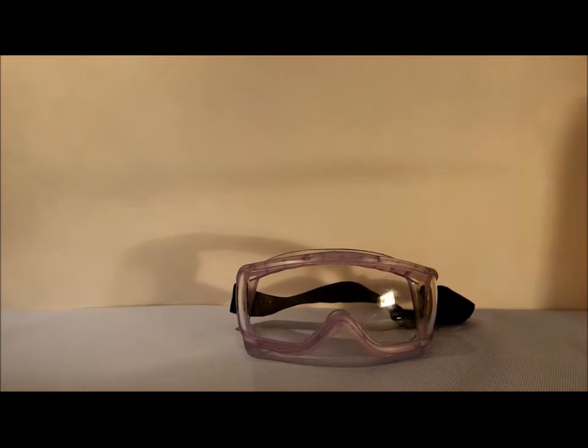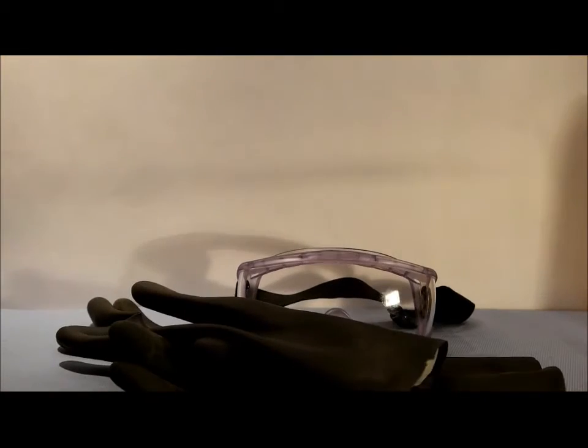If you want to try this at home I really recommend you to wear safety glasses and gloves which are resistant to acid.